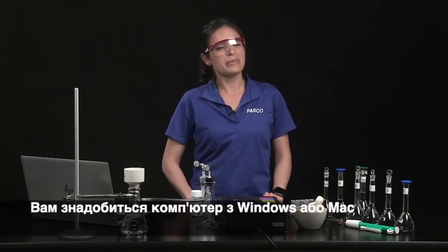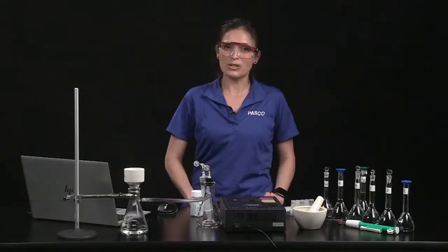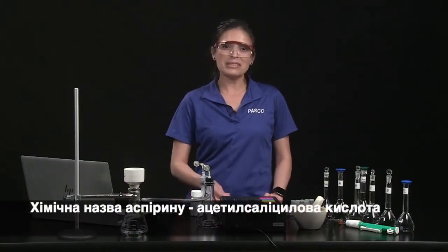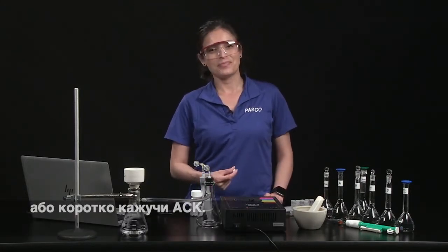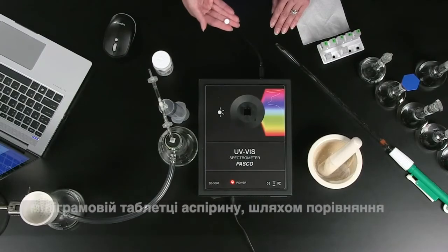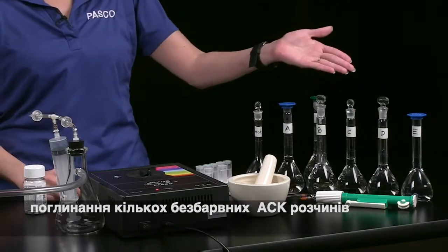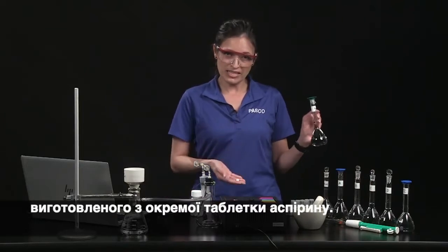You will need a Windows or Mac computer and the latest version of the spectrometry app, which is available for free at pasco.com/downloads. The chemical name for aspirin is acetylsalicylic acid, or ASA for short. You can determine the amount of ASA in an individual 325 milligram aspirin tablet by comparing the absorbance of several colorless ASA solutions of known concentrations against the absorbance of a solution made from an individual aspirin tablet.